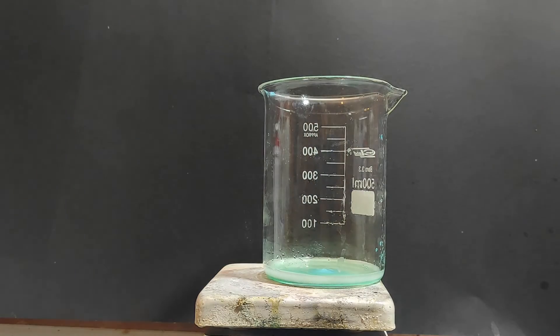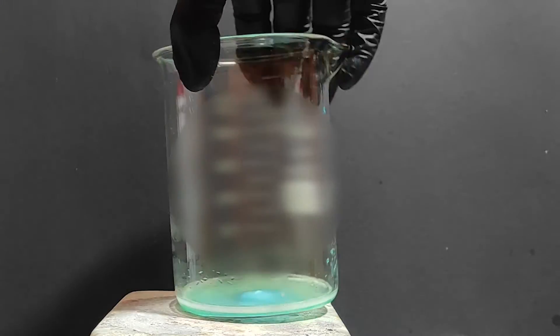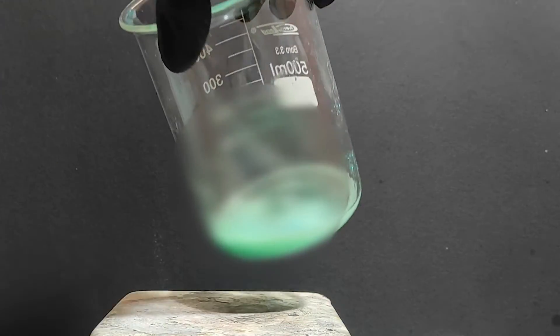This didn't bubble as much as I thought it would and that's because the sulfuric acid that you will initially get will be very dilute and so you must go ahead and concentrate it.